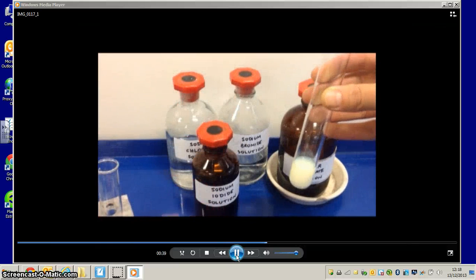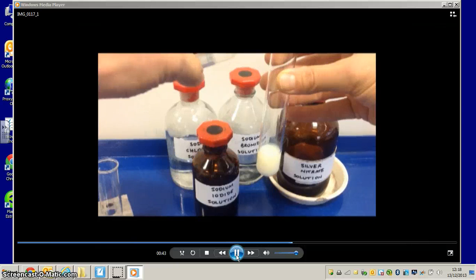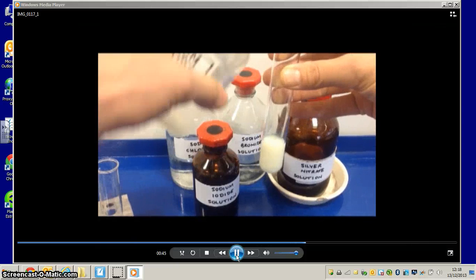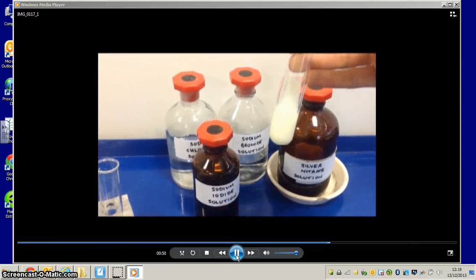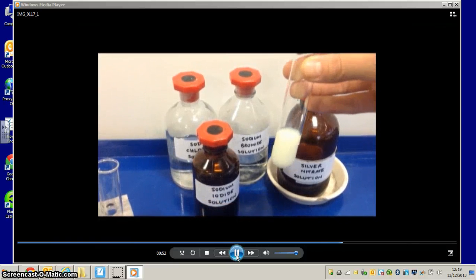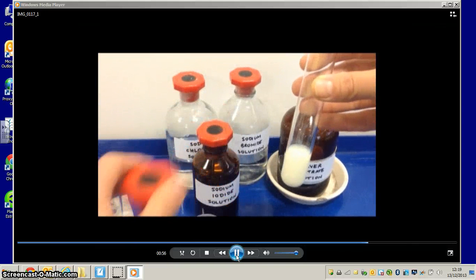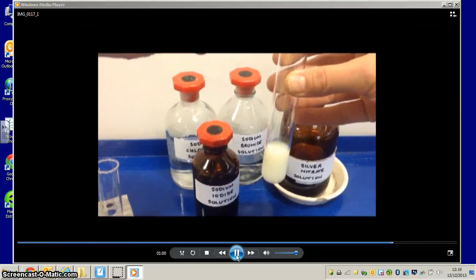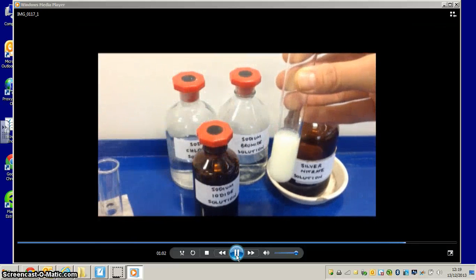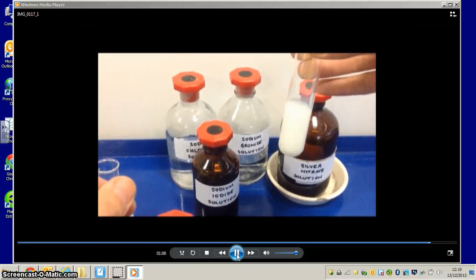So let's add the dilute ammonia like we've done previously. You'll see that there is no reaction, so the precipitate remains. And now let's add the concentrated ammonia. Once again there is no reaction, the precipitate remains.